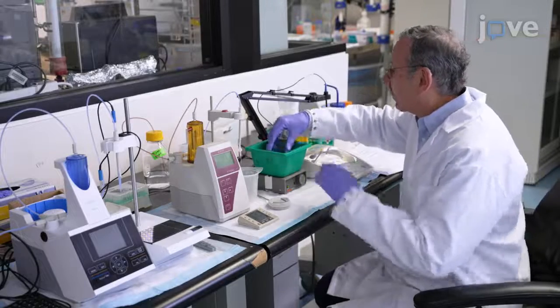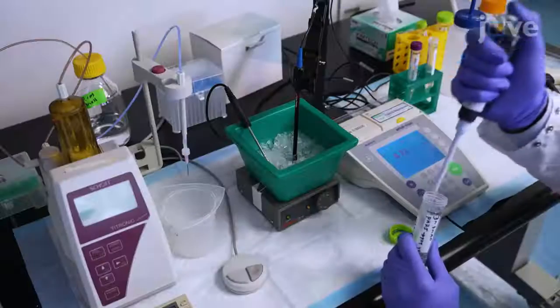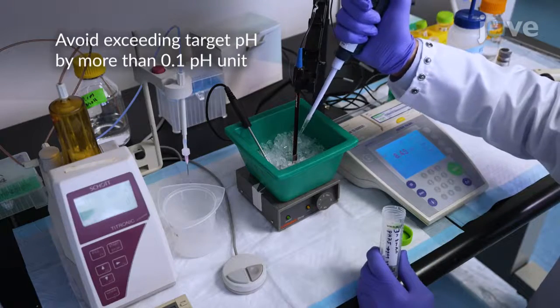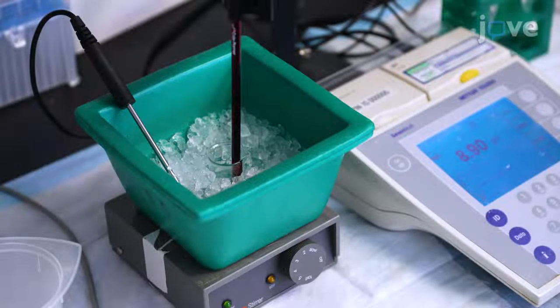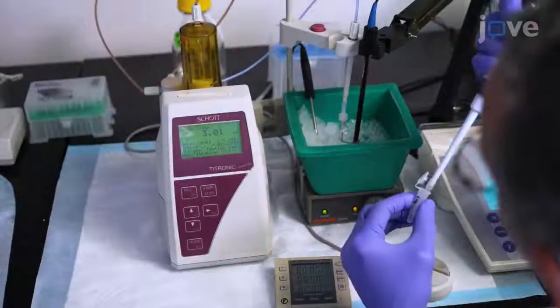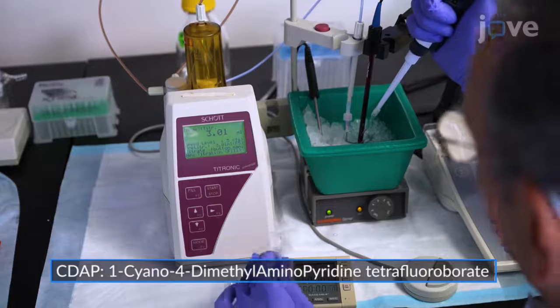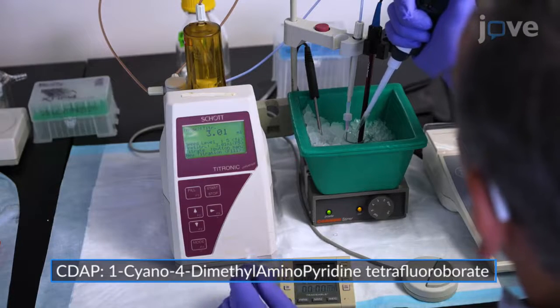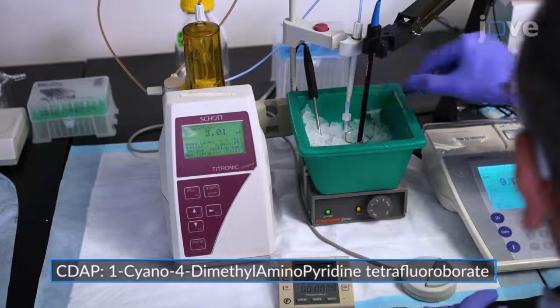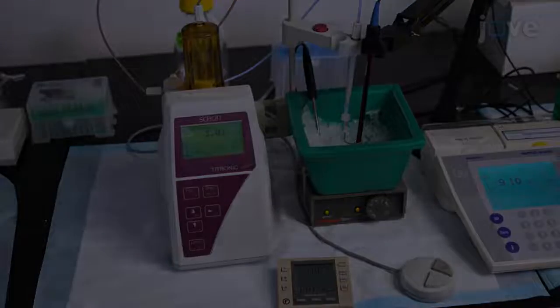Before starting the experiment, adjust the pH of the polysaccharide solution to 9 by adding 200 microliters of dimethylaminopyridine stock solution in a dropwise manner while stirring. Keep the reaction chilled in an ice water bath for the entire activation process. Proceed with CDAP activation by transferring 100 microliters of CDAP to the polysaccharide solution while stirring. Start the timer and monitor the pH change during the entire activation for 15 minutes.